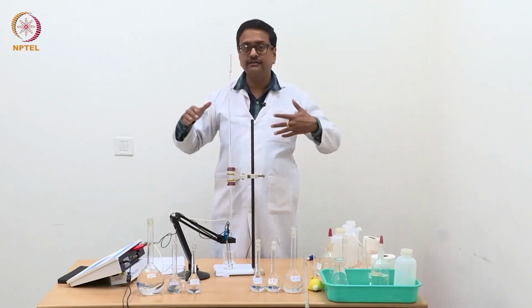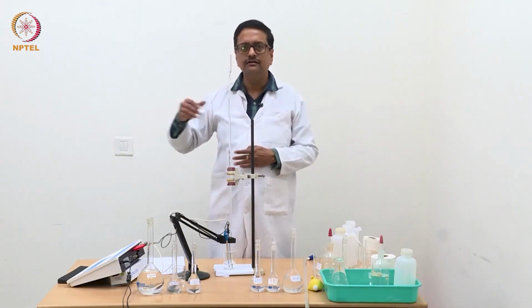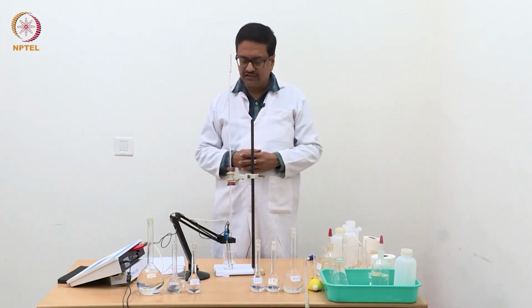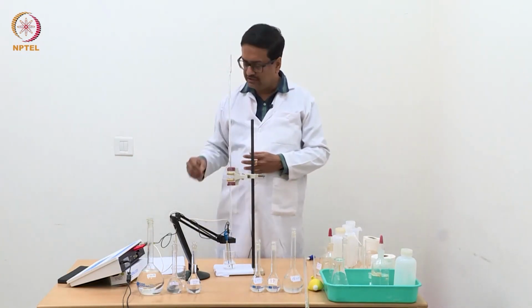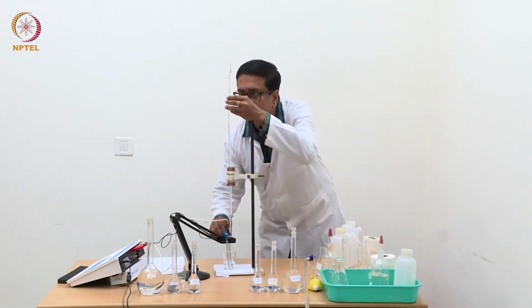So when the hydrolysis of ammonium chloride ends and the reaction is over, there is no H plus ion present in the solution, then with addition of more and more amount of NaOH, we will see a constant increase in conductance. So let us continue addition as usual.